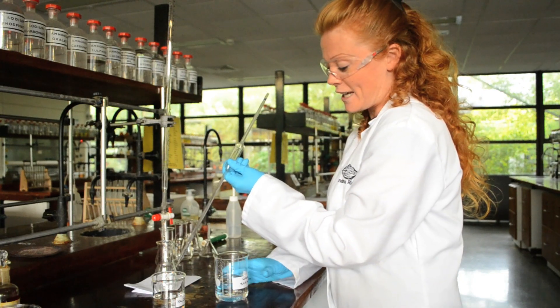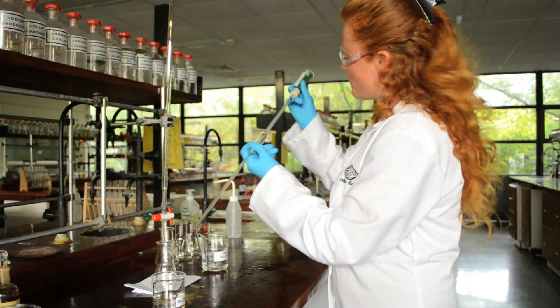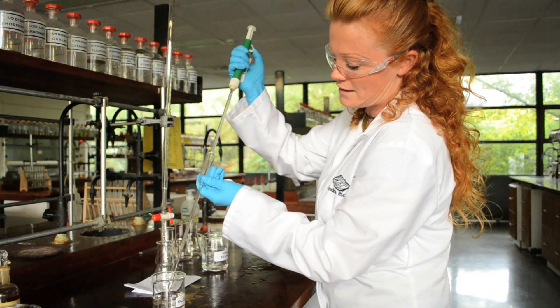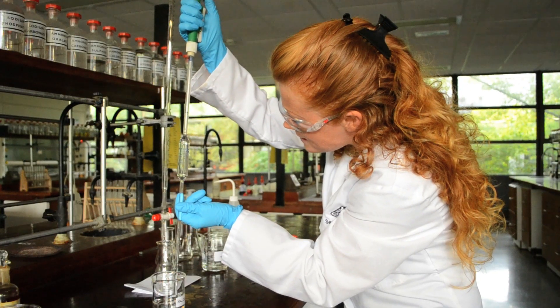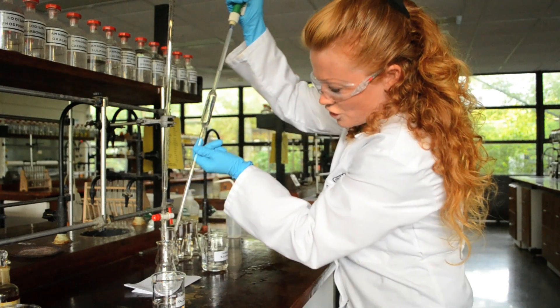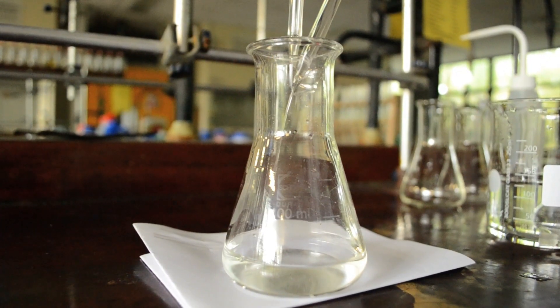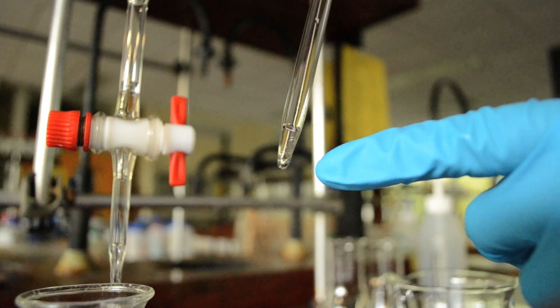I'm going to fill my pipette using a pipette filler. We're not going to do it like they did in the old days, sucking up through the pipette. I attach the pipette filler onto the pipette and take my sodium carbonate solution from the clean beaker I just filled. I fill the pipette all the way up to the graduation mark so that the bottom of the meniscus is sitting perfectly on the graduation mark at eye level. I make sure there are no bubbles in the pipette, then transfer to the conical flask. At the end, I touch the pipette off the conical flask to remove the final drops. There will always be one drop left, which is accounted for within the graduation.